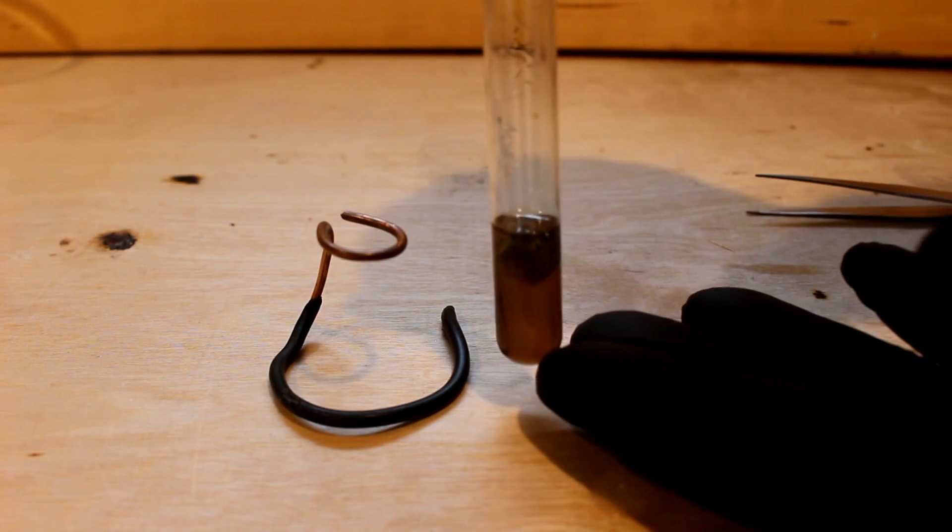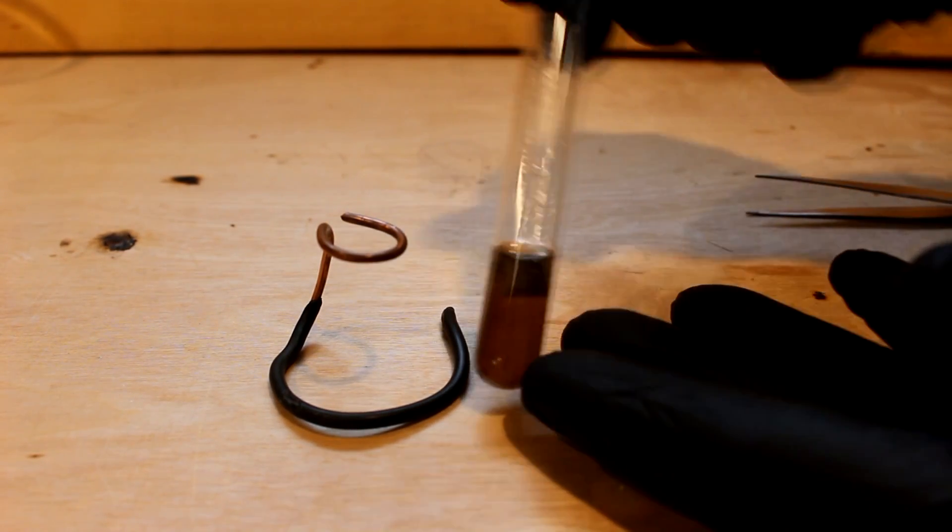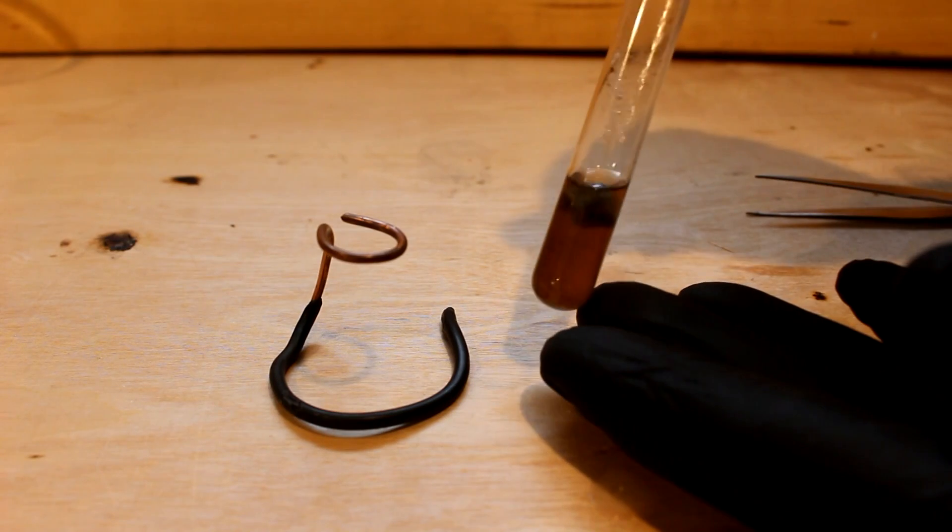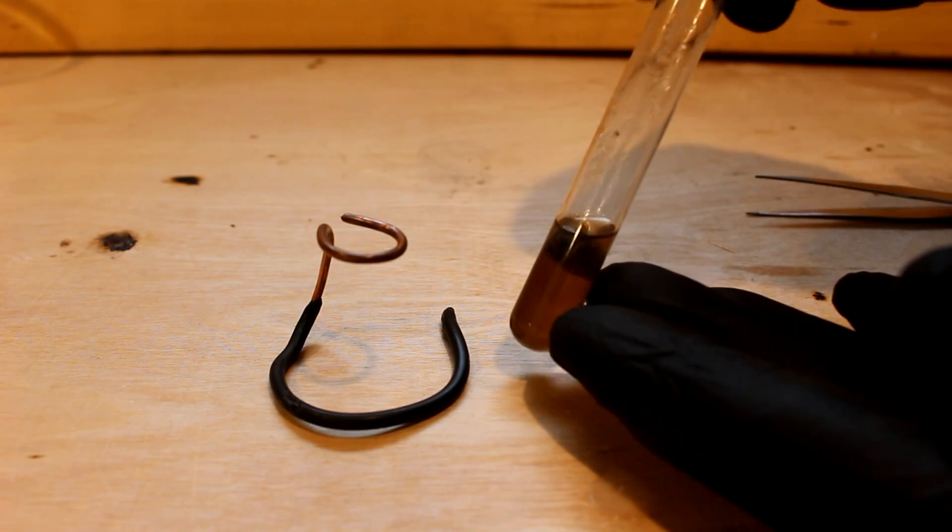Okay. Give it a little shake. Make sure it's floating. And it is. Look at that. That is corundum floating on liquid.